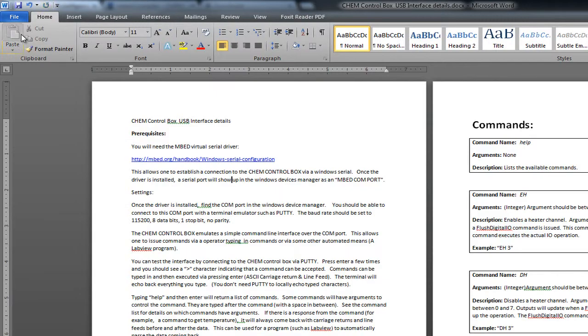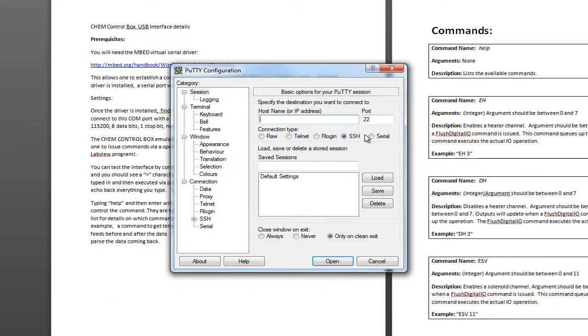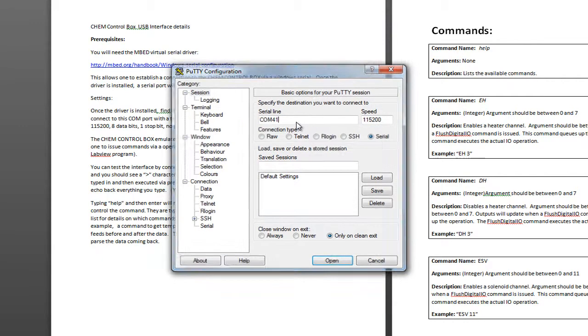Now, there's a couple different ways you can use this. At the lowest level, you can drive it all from a command line. So I have a program called PuTTY. Let me drag PuTTY over here, and let me go serial. The baud rate is 115,200. And I just remember it was COM41 for me.